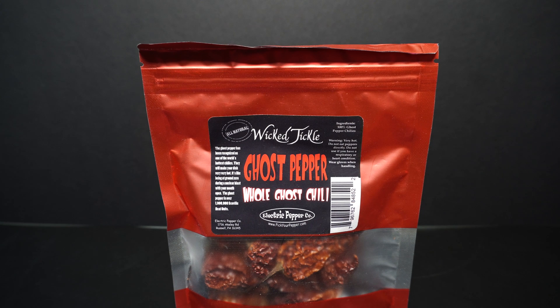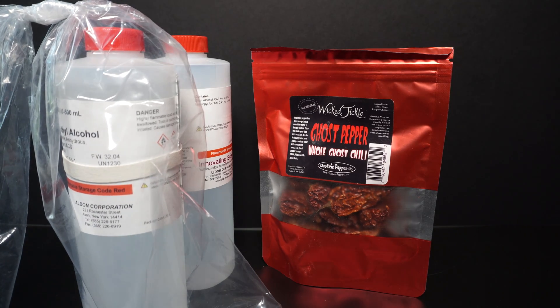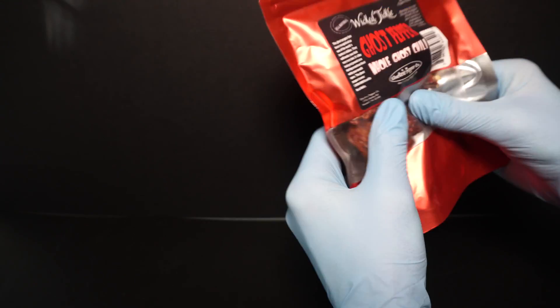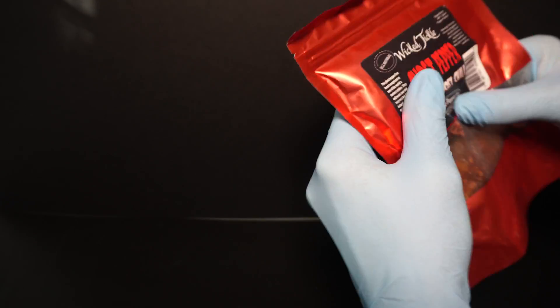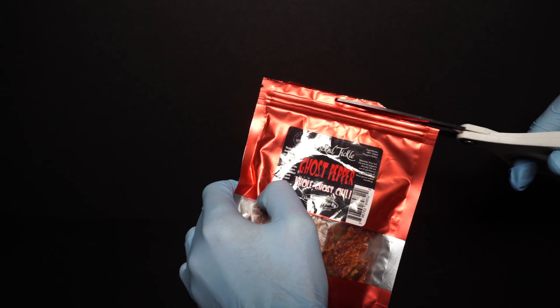So let's get started. All we need for this project is about 200 milliliters of an alcohol — I used ethanol, but you could also use methanol, isopropyl, or even acetone. Then the peppers we wish to extract from. It's important to note that this extraction will extract more than just the capsaicin; it will also extract the beta-carotene and some other capsaicinoids as well. The first thing we do is crush our ghost peppers into small pieces without turning them into dust. The reason we need moderately sized pieces is that if they are too small, the dust will bypass our cotton filter and go into our solution. This will make it harder to filter later, though we want them small enough because crushing our peppers will increase the surface area, allowing a higher yield.